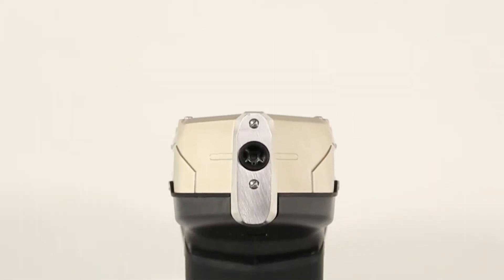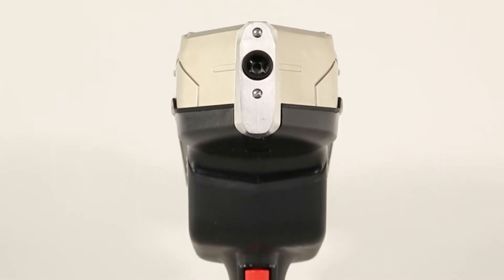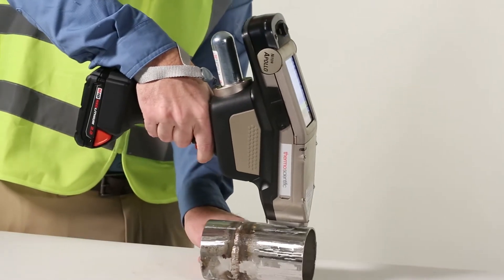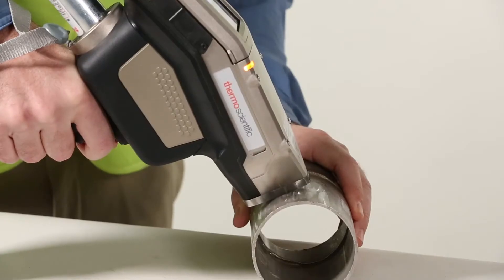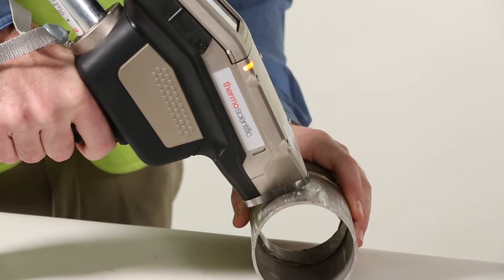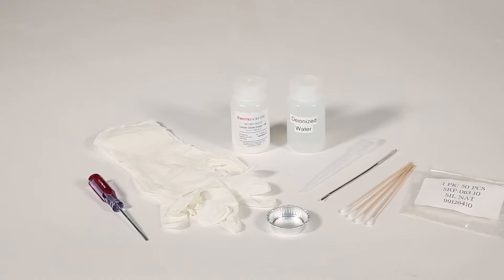Maintaining a clean instrument ensures that you will achieve optimal analytical performance. During analysis, metal particles will accumulate on the optic windows. Over time, particle accumulation will degrade signal throughput and impact the integrity of your results.